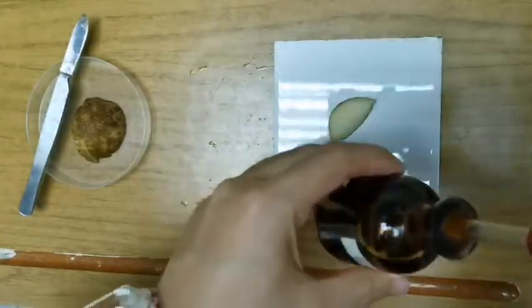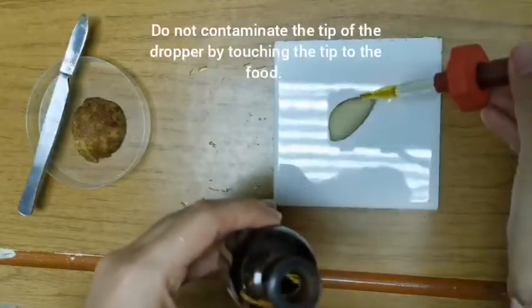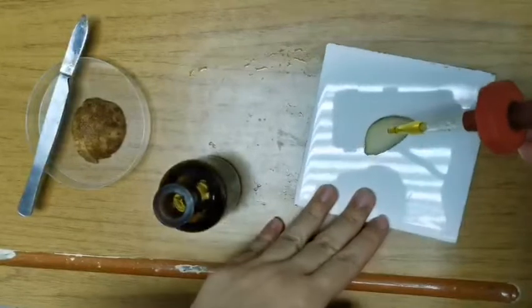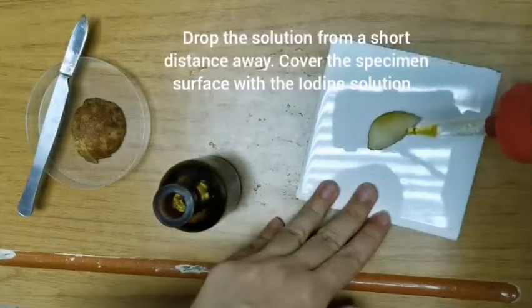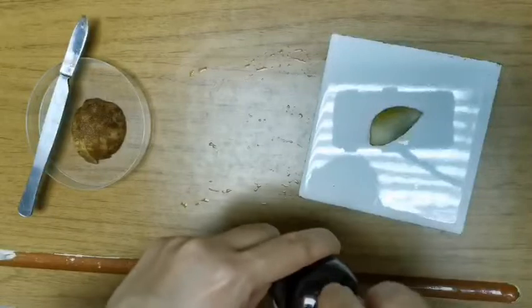So you take your iodine solution. Iodine solution comes in a dropper. Do not go so near that it touches your potato, or your food specimen. It can be 1 or 2 centimeters away, and then just drop it from a distance. Just drop 1, 2, 3, and that should be enough to show you any color change if starch is present.